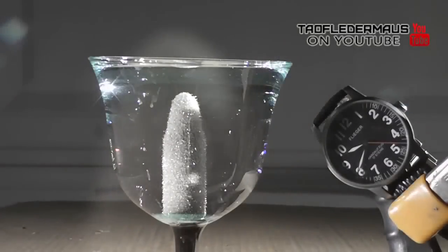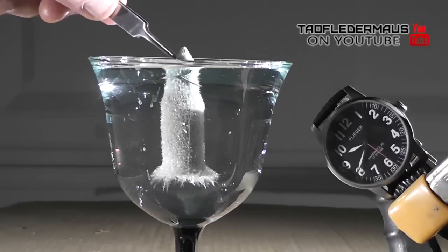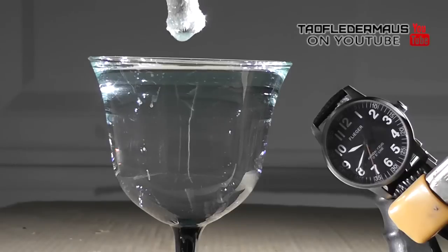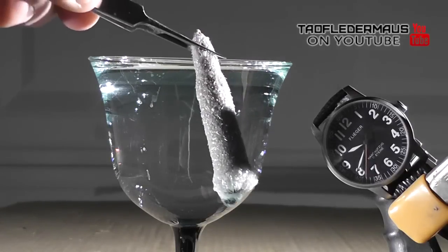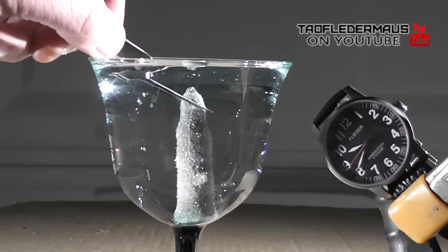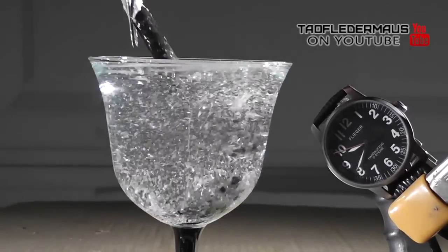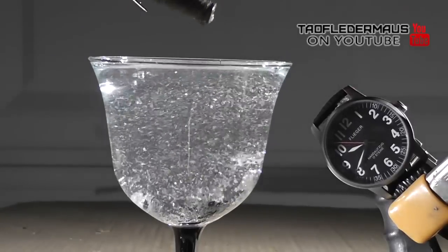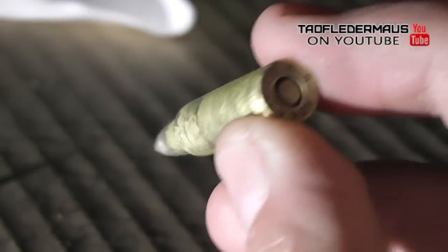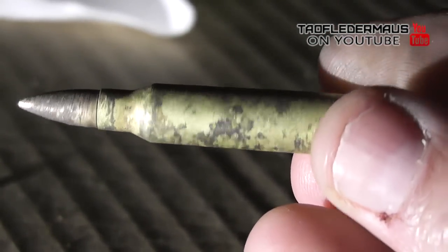Next we'll remove it from the solution just to show you how it looks outside and how fragile it is. All we have to do is knock it around a little bit and we can remove all the silver crystals from the surface. After 30 minutes in the solution, our rifle round brass is pretty chewed up and pitted, but there was a good chance it would still fire.